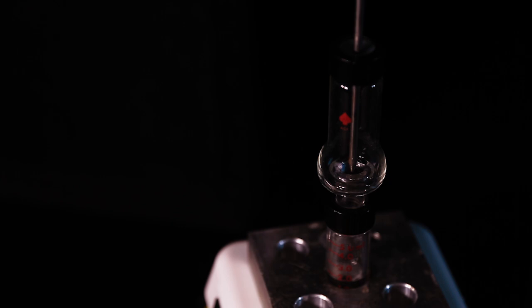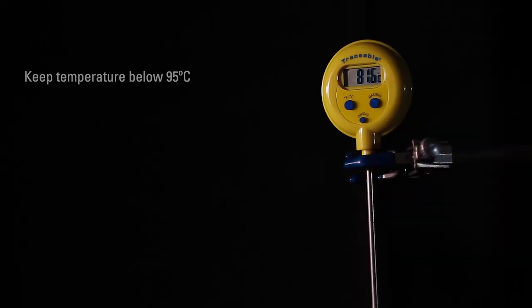Heat the reaction mixture to boiling. Note the temperature of the stillhead as you are collecting distillate. Keep the temperature of the distillation below 95 degrees Celsius.